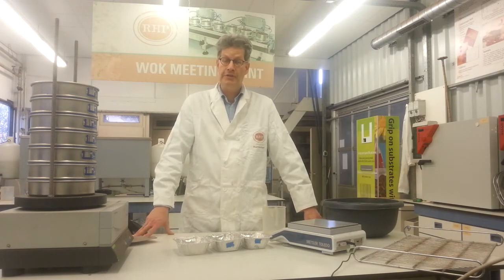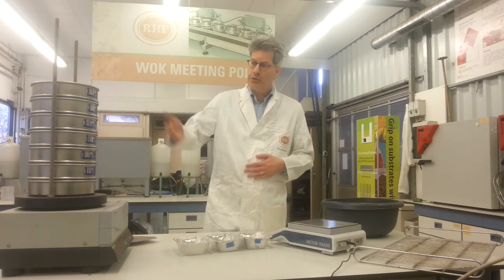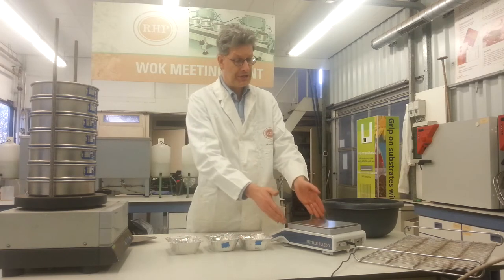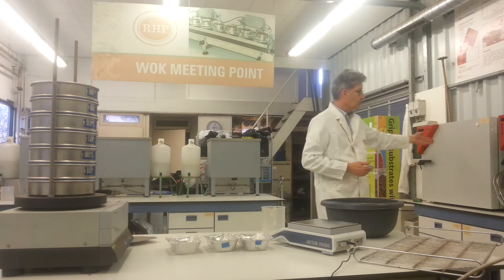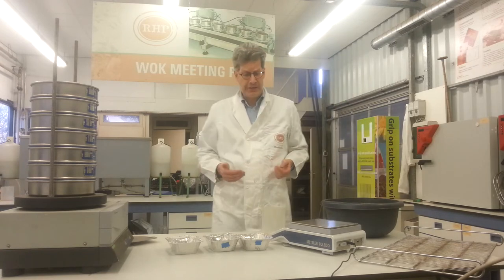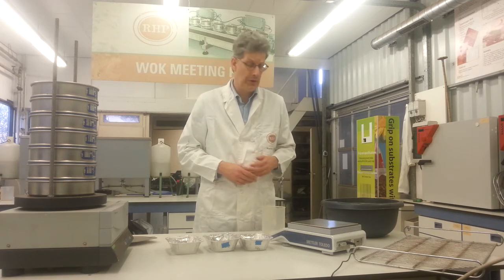I would like to demonstrate the sieve analysis to you. What do we need for a sieve analysis? Of course a sieve shaker. We need some troughs to dry the peat in. We need a scale. And we need a drying stove, which you can see here at the back. I'll take you through this analysis step by step. Of course there are waiting steps, but for demonstration we do it in one run.